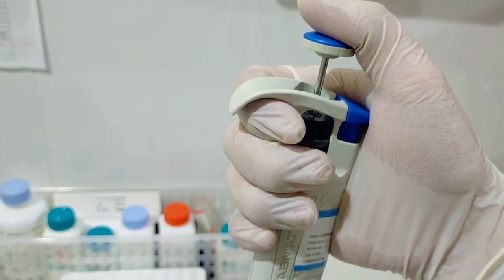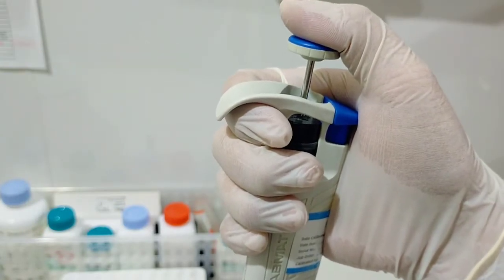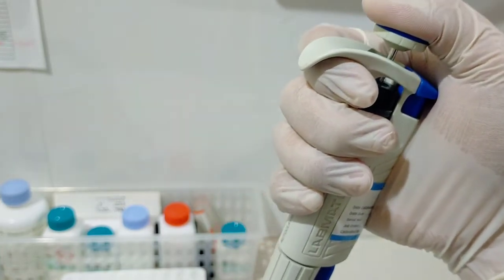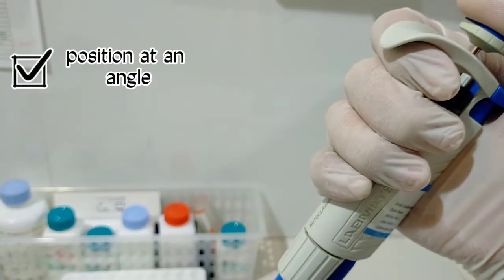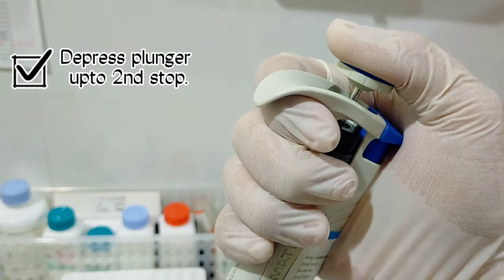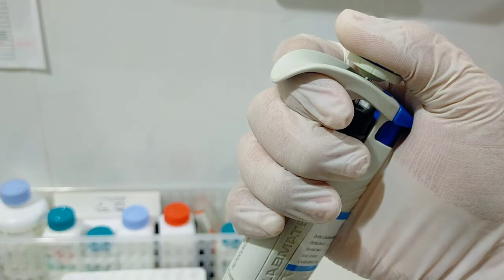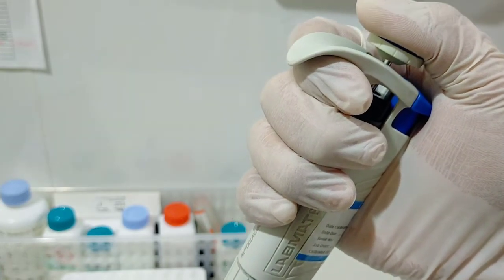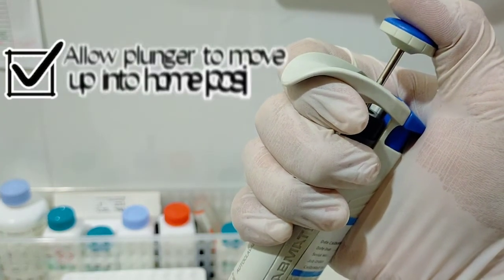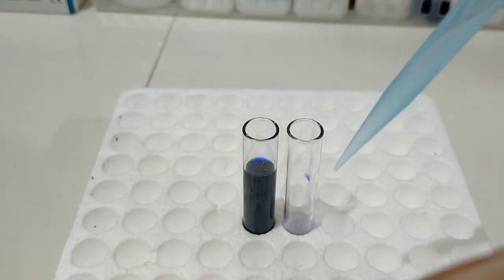In the distribution step, you have to depress the plunger to the first stop position to distribute the volume. Then, after putting the tip at an angle, actually 10 to 45 degrees, depress the plunger up until the second stop. So push it once more. When you have released all the volume that you have aspirated, slowly allow the plunger to move up to the rest position again. This time I'm going to show you the step-by-step procedure in aspirating liquid solutions or reagents.